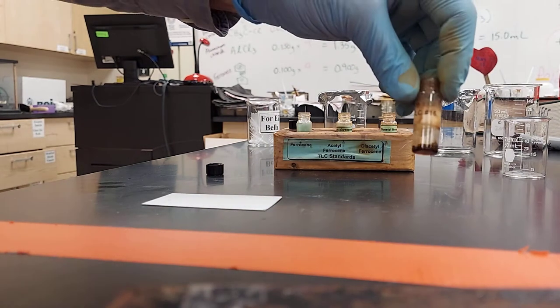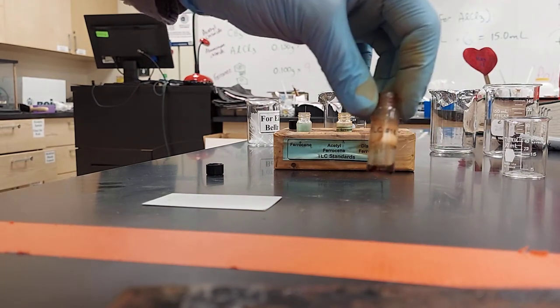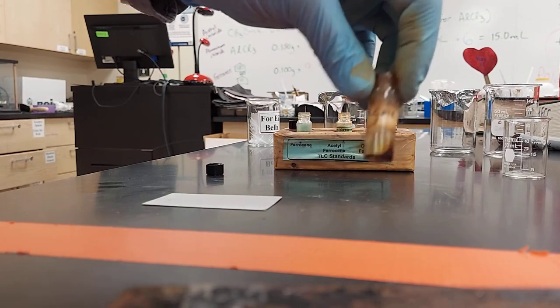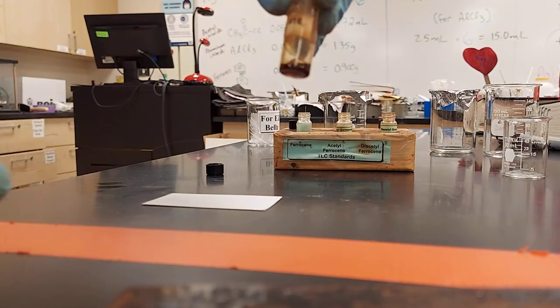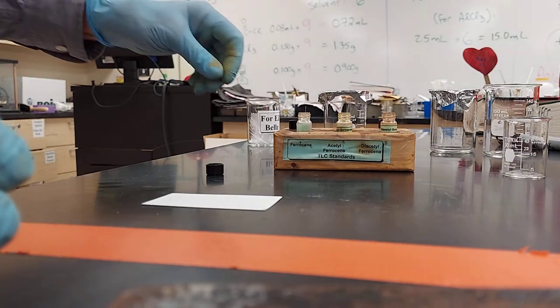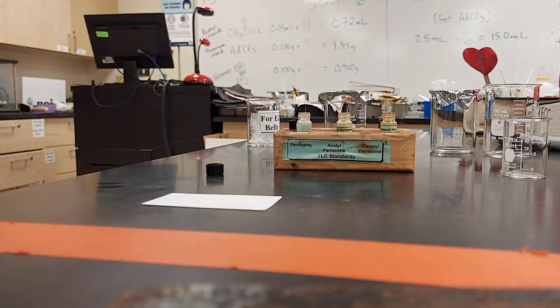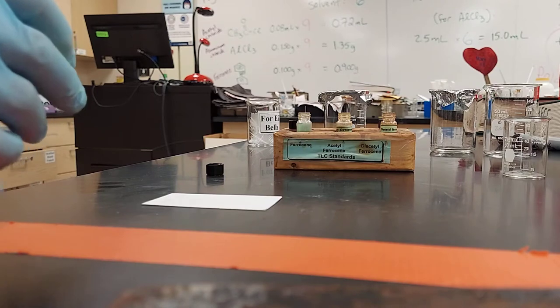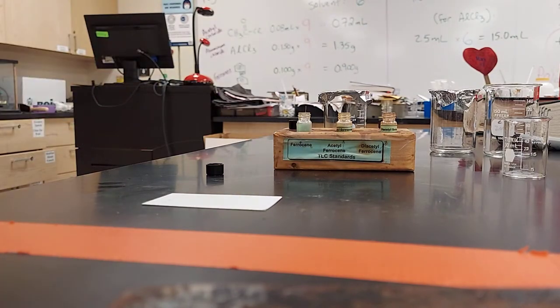And I just broke my TLC applicator. Remember, this was the aliquot from today's experiment, but you'll have one that says TLC number X. And you'll determine what's in TLC X as part of the experiment. And you'll need another applicator, because I broke mine.